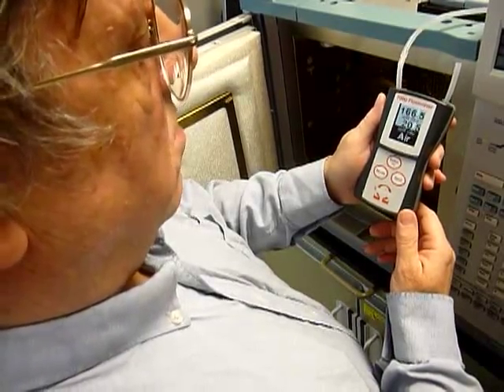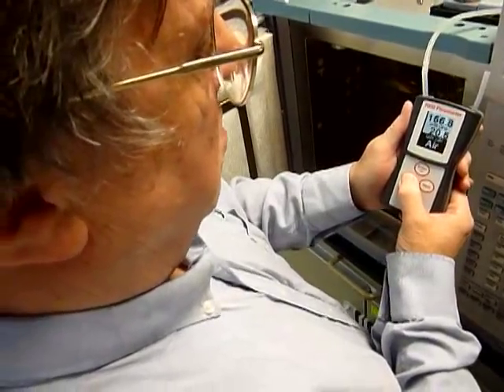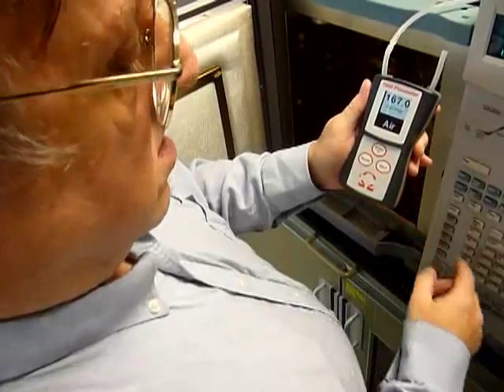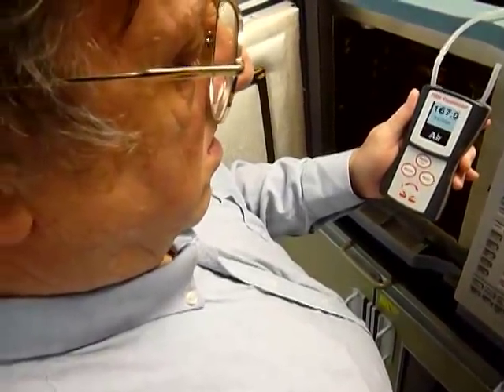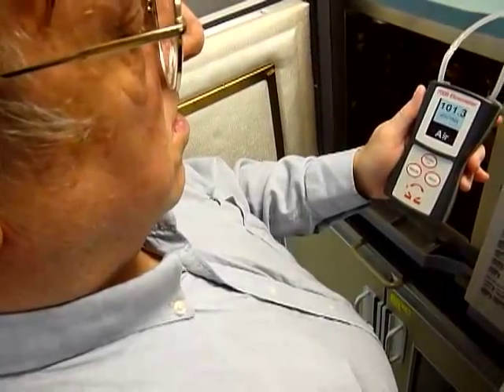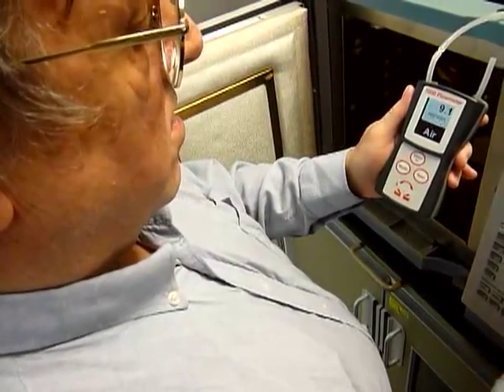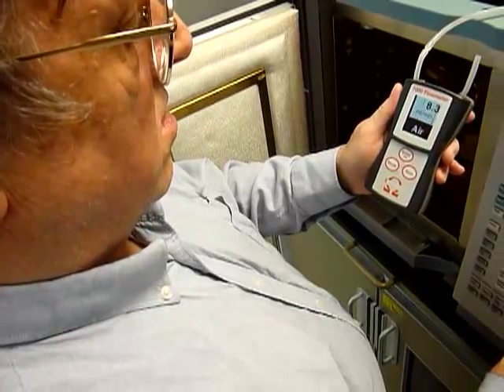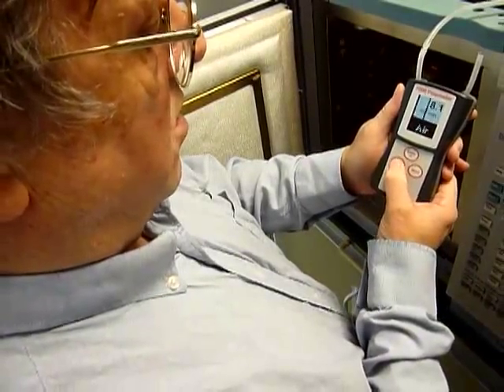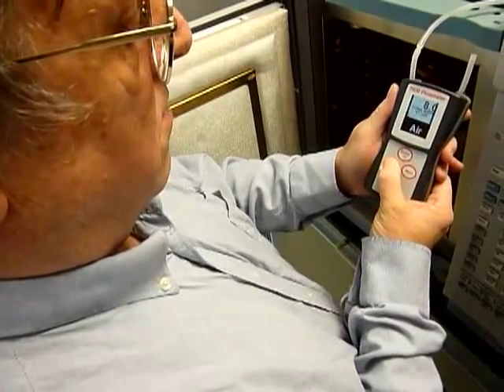To change back to normal flow measurement, press the mode key. To switch the instrument off, press and hold the mode key for a few seconds.